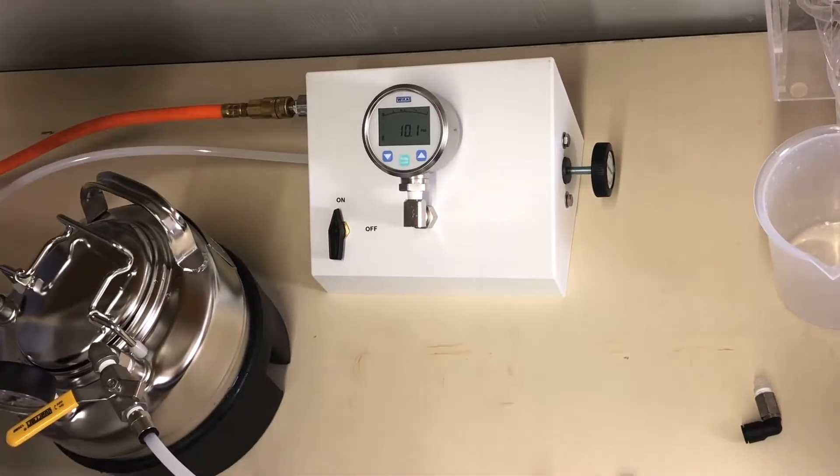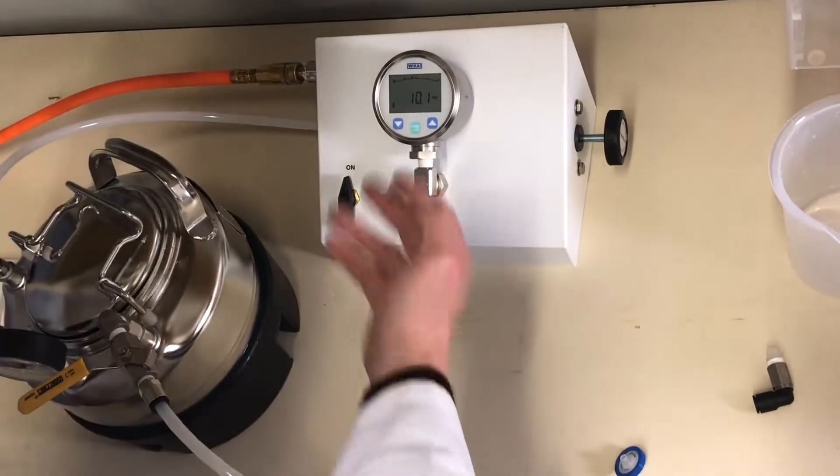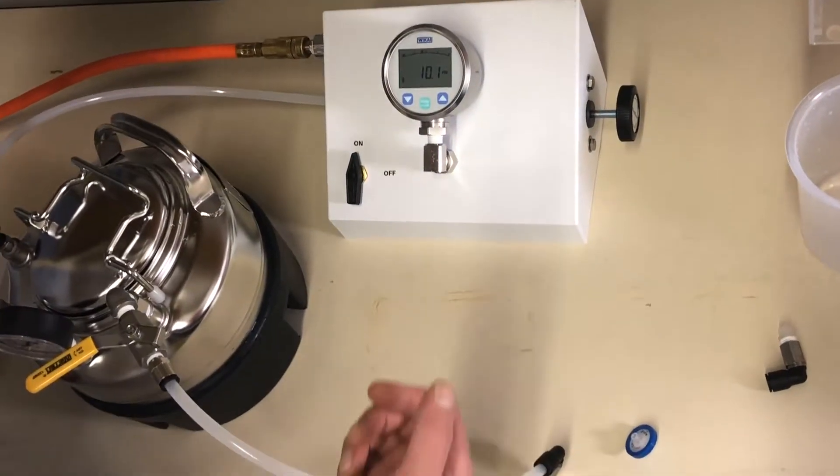10 plus or minus 0.2, so we'll live with the 10.1, that's good.